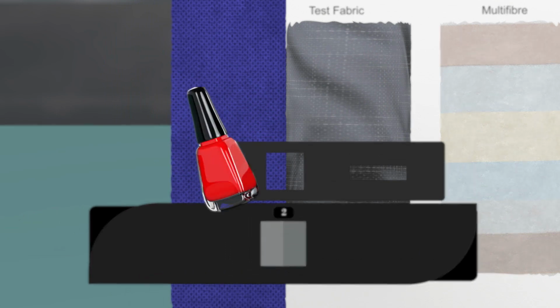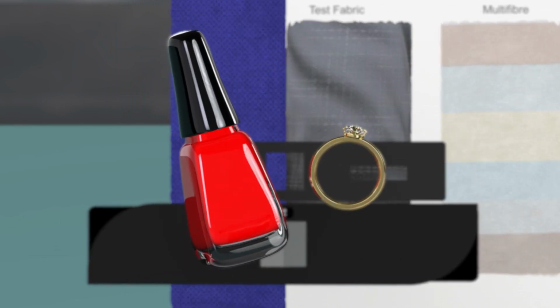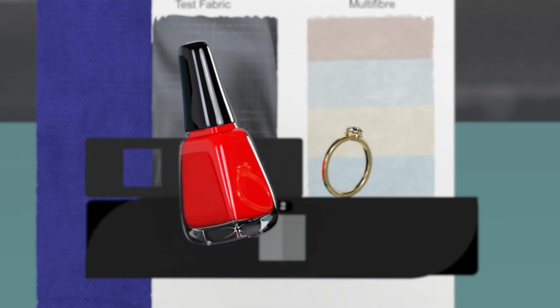When the area has been masked off, slide the grayscale through its grades until you find the level of contrast which is most comparable. Remember that the grayscale should be placed below the fabric to avoid any shadows which may affect the result. Hands should also be free of any nail polish or jewellery that may affect reflectance.